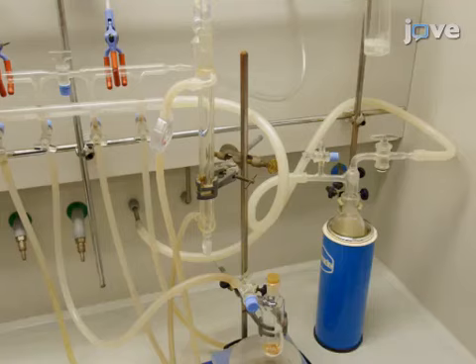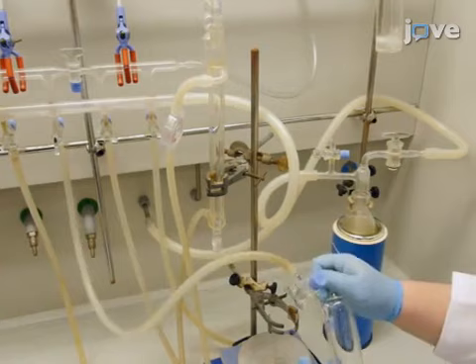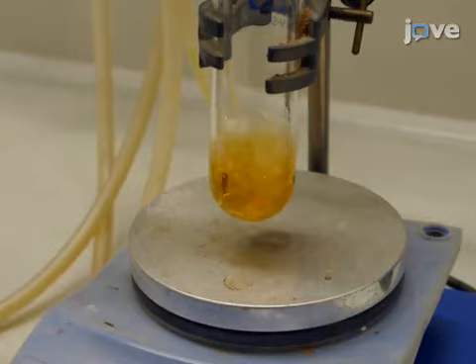Put the solids under nitrogen atmosphere by three cycles of gas evacuation, followed by refilling with inert gas in the Schlenk line. Then add 21 milliliters of carbon tetrachloride. De-gas the solution by the same evacuation and refilling process with vigorous stirring, taking care to prevent massive loss of solvent. Reflux the mixture at 77 degrees Celsius.